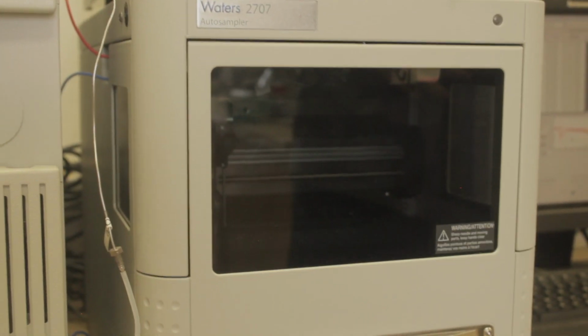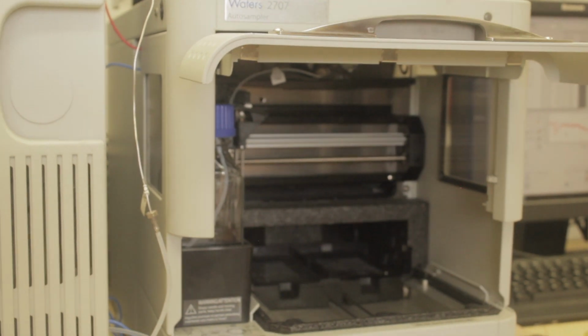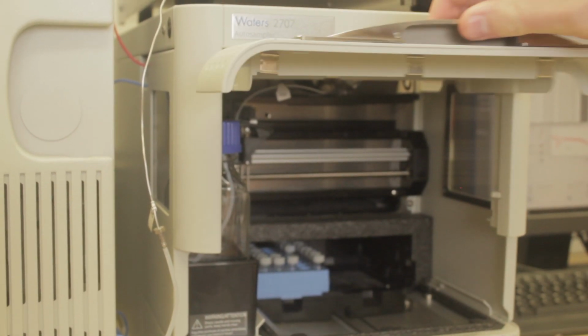The primary work I do revolves around using Raman spectroscopy to diagnose various biotic and abiotic stresses within crops. Several undergrads helped me with these projects, and I've also had the opportunity to assist with their own projects. In addition, I utilize high-performance liquid chromatography, also known as HPLC, and inductively coupled plasma mass spectrometry, also known as ICP-MS, for further investigations. Besides forensics, I apply myself to plant science as well. In plants, I use Raman spectroscopy on hemp and HPLC analysis on tomatoes.